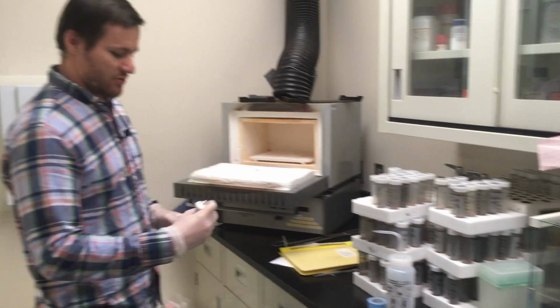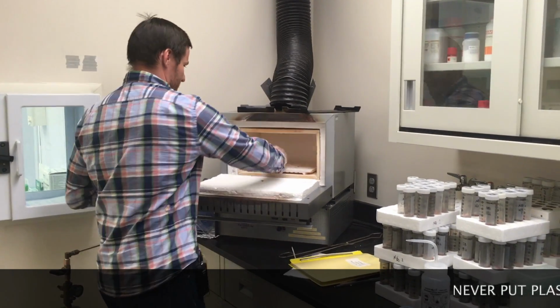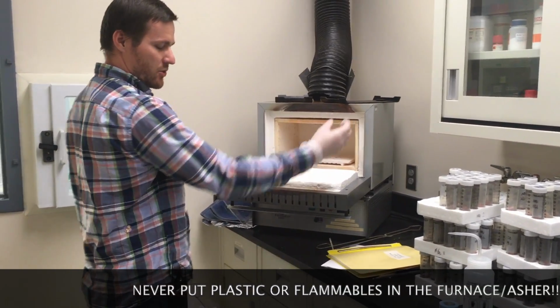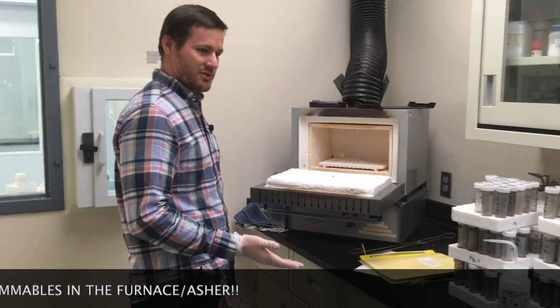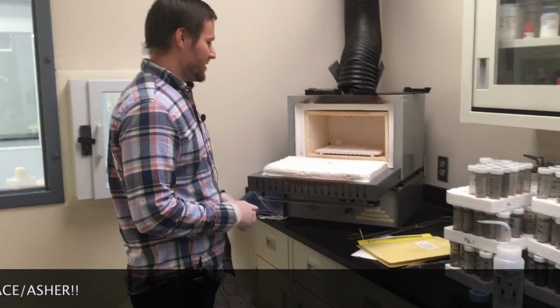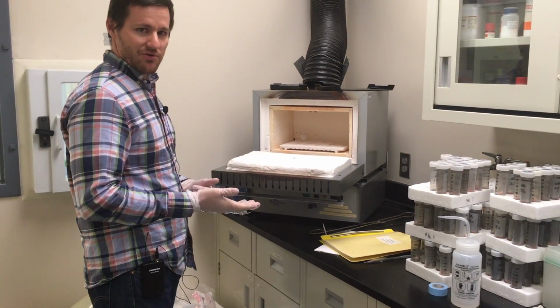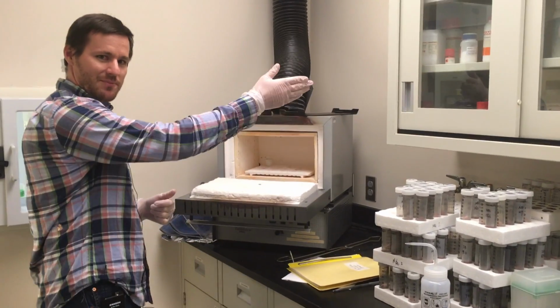So then your crucible, it's marked, it's got the sample in it, it's ready to go into the asher. I'm right-handed, so I like to start at the back left corner and then put samples in sequentially. You want to keep in mind that the crucibles will tip over. Those lids aren't screw tight or anything like that. And so you want to put them in an order where you're not going to bump the other ones. So this strategy has worked for me. If you're left-handed, you might want to start from the opposite end, the top right.